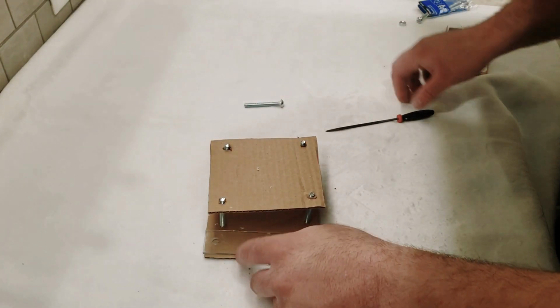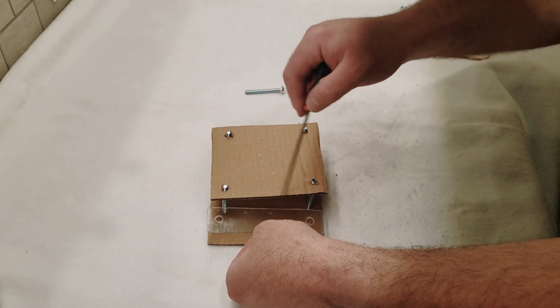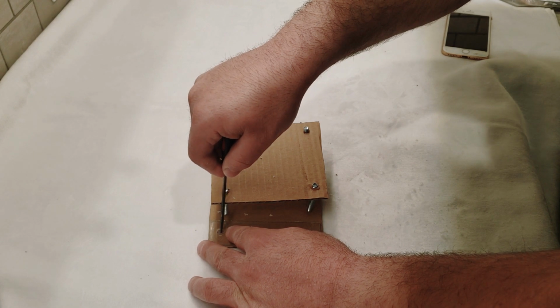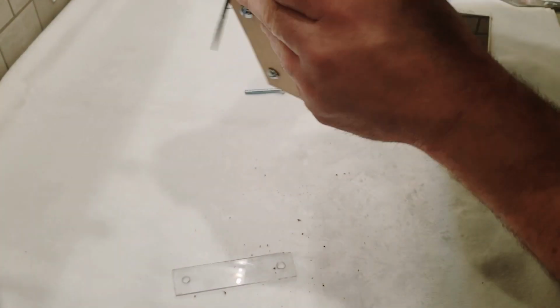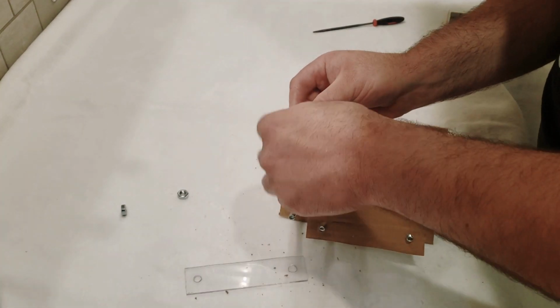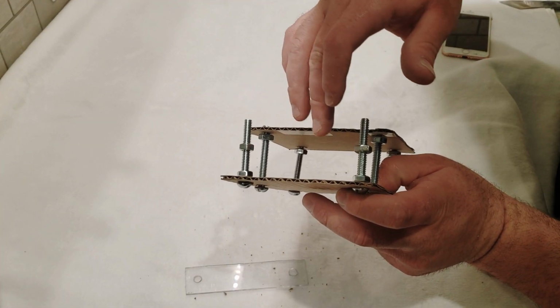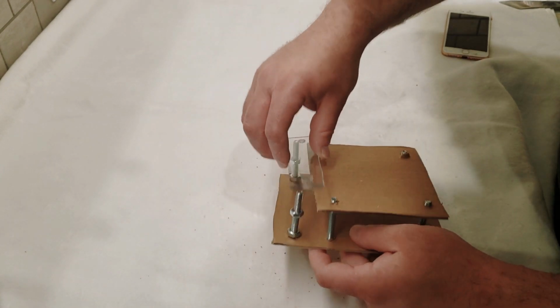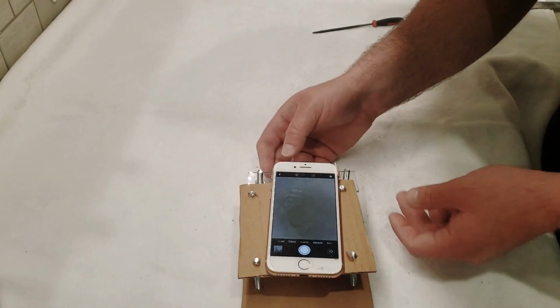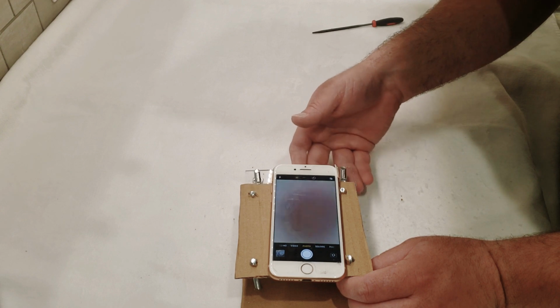So now let me flip it around so you guys can see. I'm going to put this up, and we want it to be kind of right here. The phone's going to be hanging off the edge. So we'll set it right here, and just poke these holes where we want them. Close, and now we can just set this slide on top of it. And now we can put some stuff on the slide that might be interesting to look at.